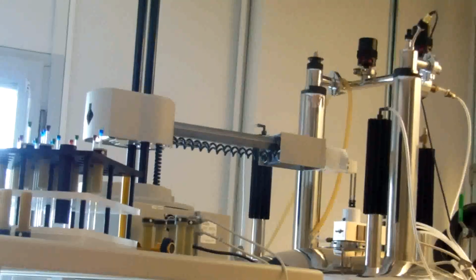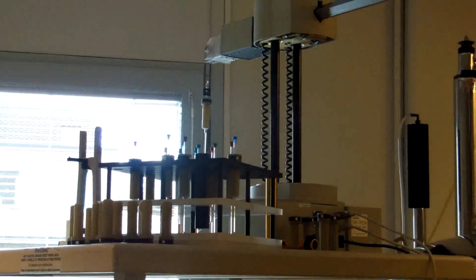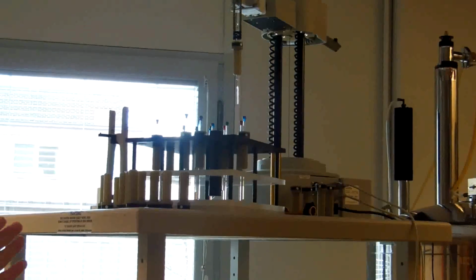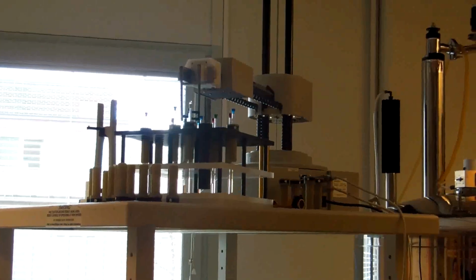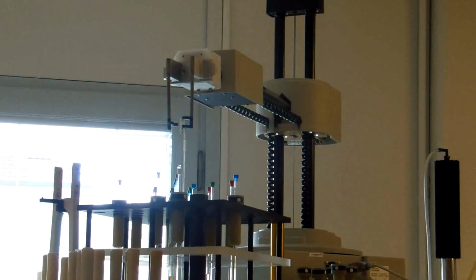It goes to take it out and put it in its place. Look, mashallah, something really funny. So it will put it in the machine. Right. This is the reference sample. After that, it will go and take our sample.